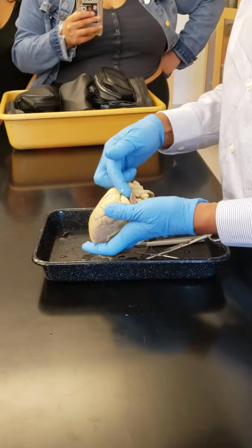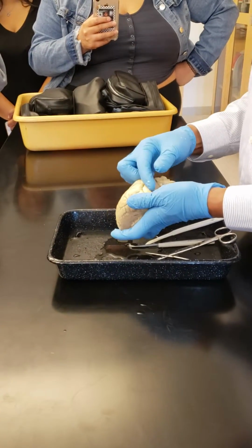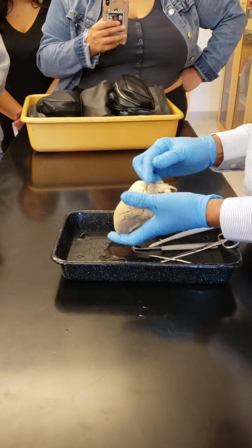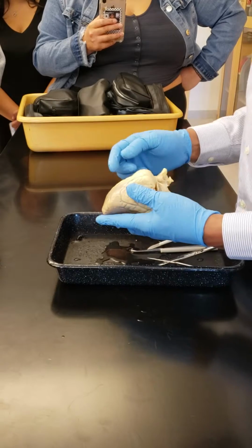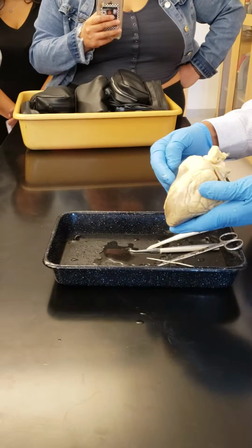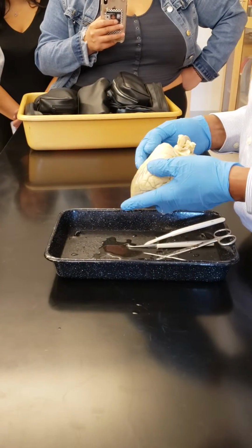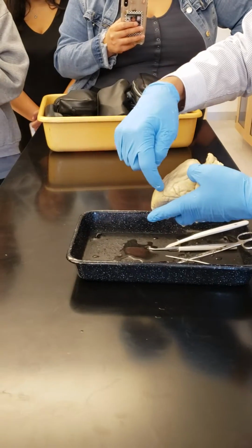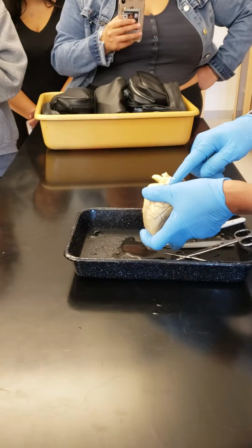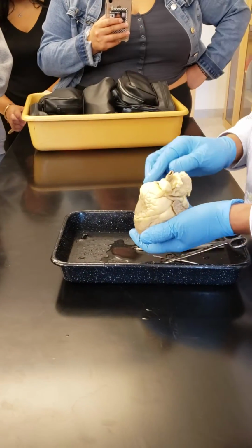Then this groove here, between atrium and the ventricle, is the coronary sulcus, or you can say atrioventricular sulcus. Okay? If this is the front side, which chamber is this? As if you're looking at my heart, this is right ventricle, this is left ventricle, this is right atrium and the left atrium, and you can see some of these flap-like auricles or pinna.